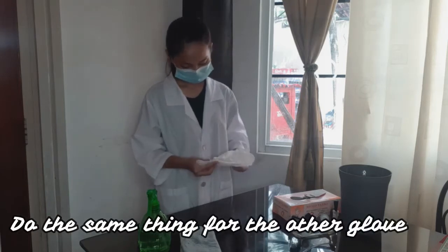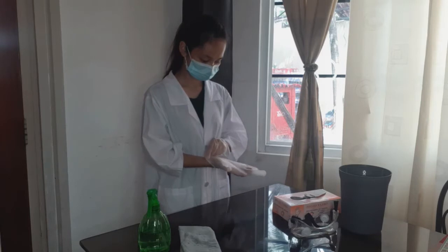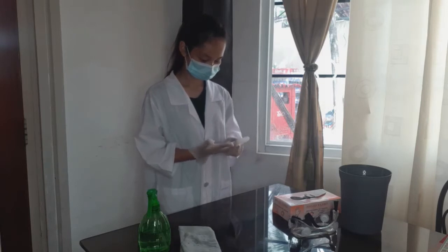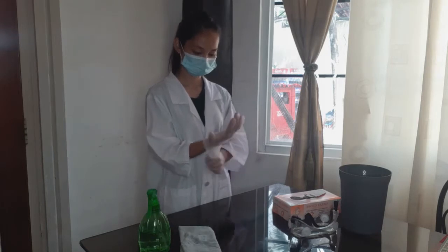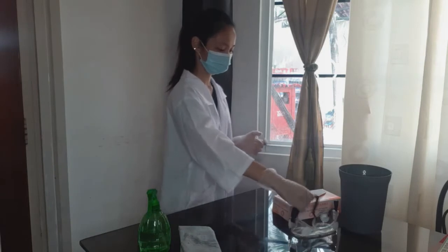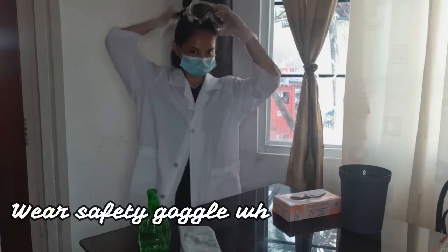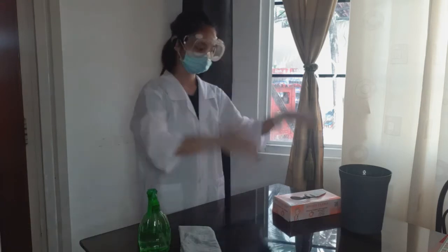Do the same thing for the other glove. Wear safety goggles when handling liquid disinfecting chemicals to protect your eyes.